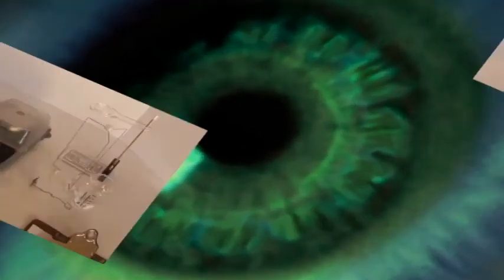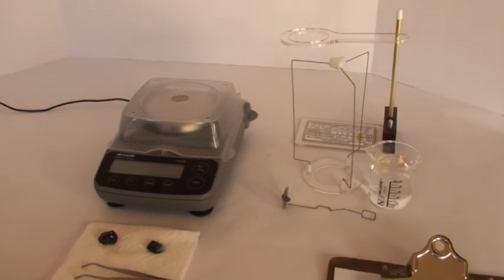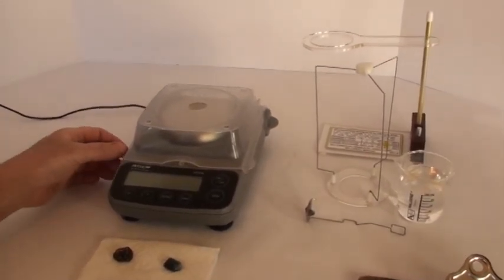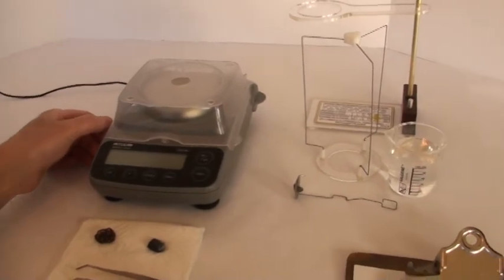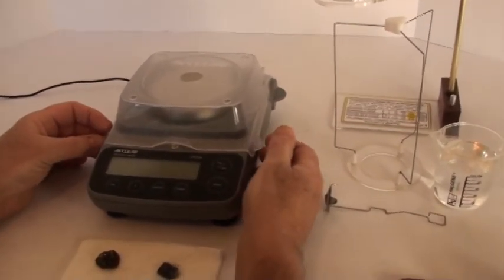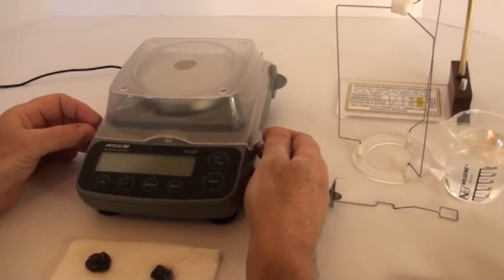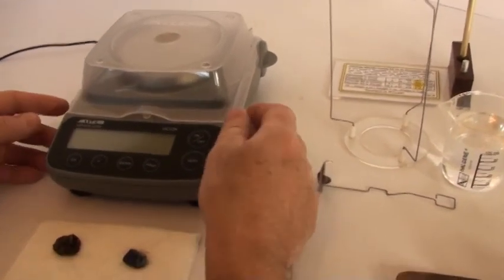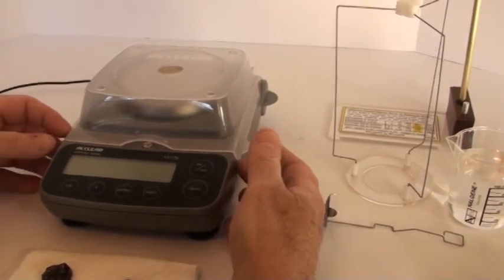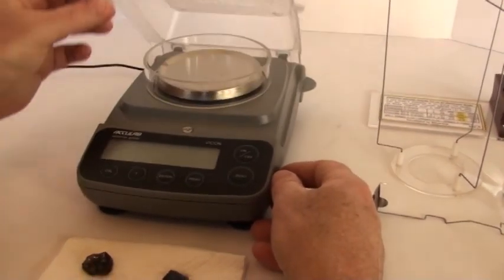Hi, this is Tim from Mineral Lab again, here today to demonstrate our universal specific gravity kit for an electronic scale. In this case, we are using our bench scale version of the kit. Here is our bench scale. You want to start with your scale leveled out properly. Use any screw adjusting leveling feet to achieve that. Then open any draft shield type lid.